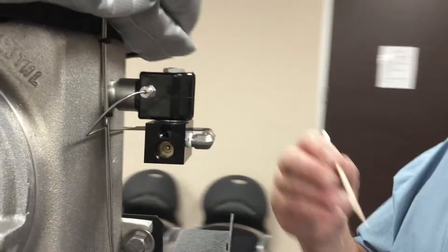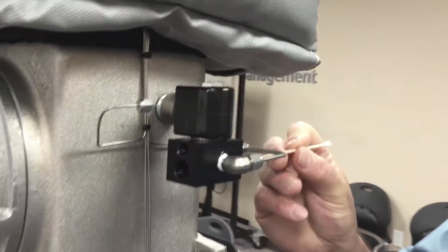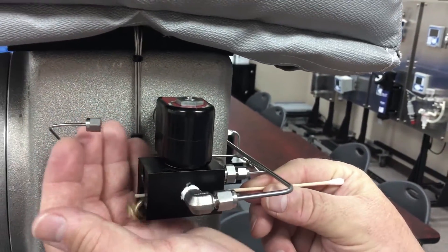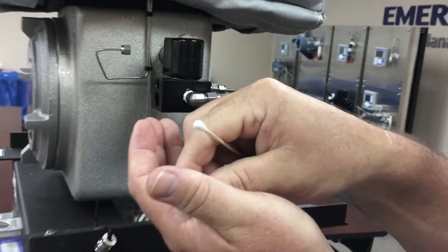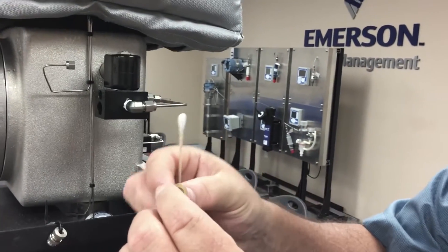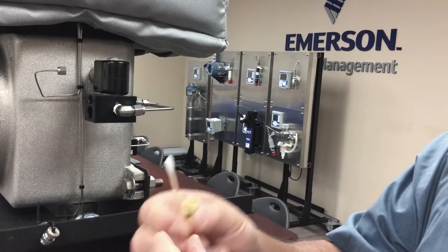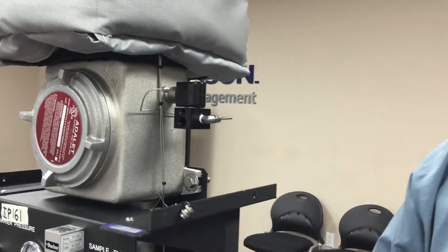The next thing we can do is in the back there is a vent. We'll use the Q-tip to push out the old spool. This is the old spool, and you can tell it's goldish in color, it's aluminum anodized. We're going to also discard this.